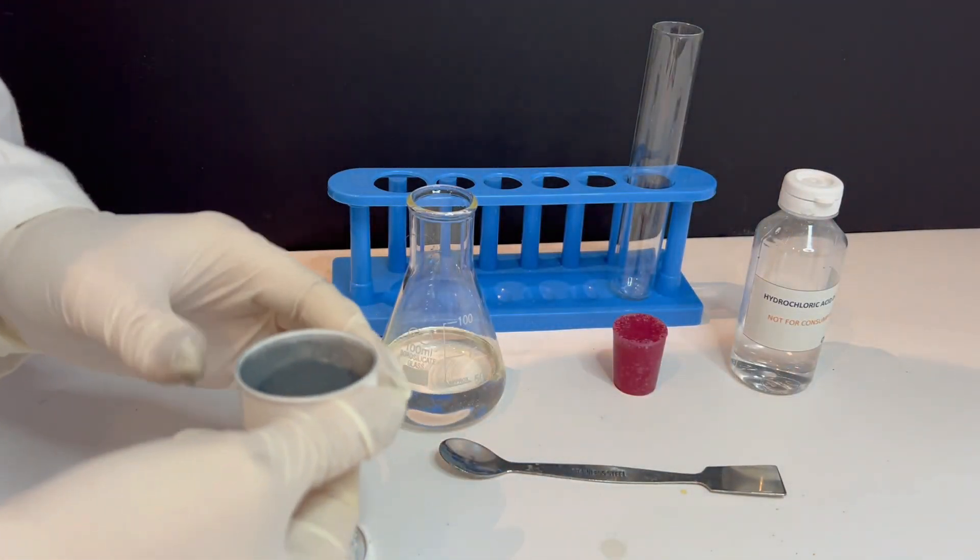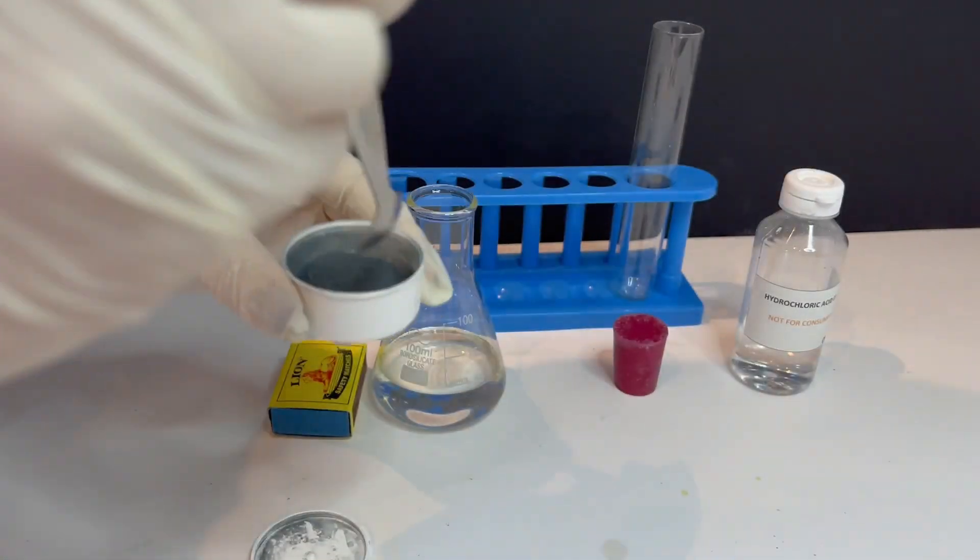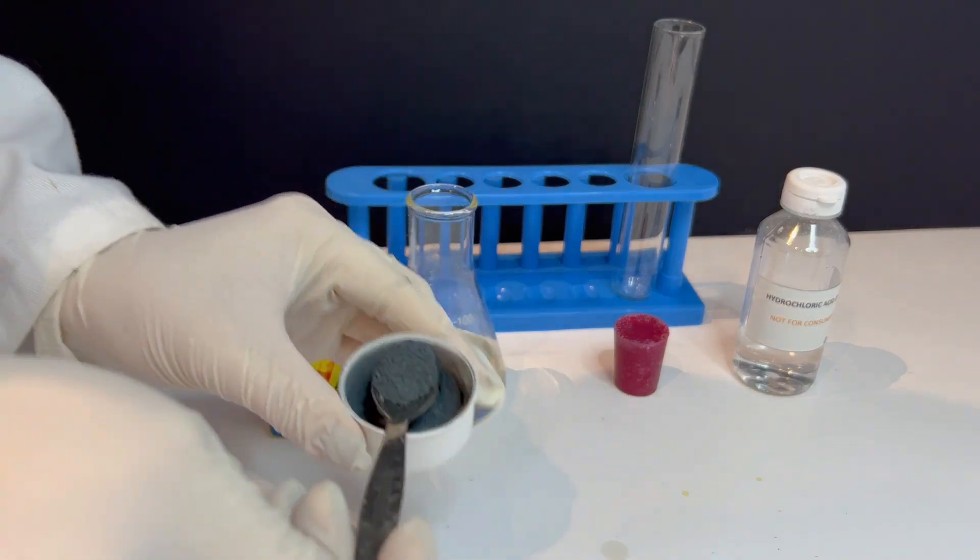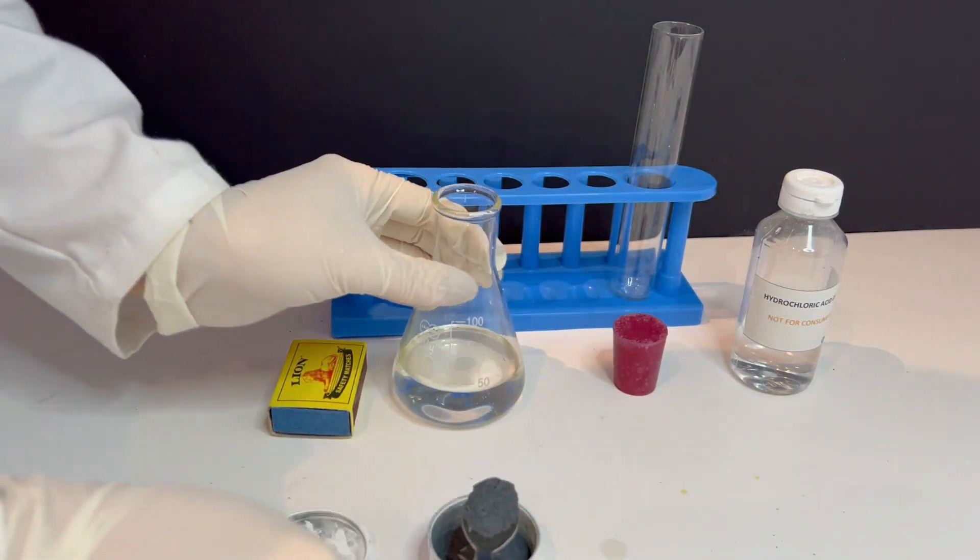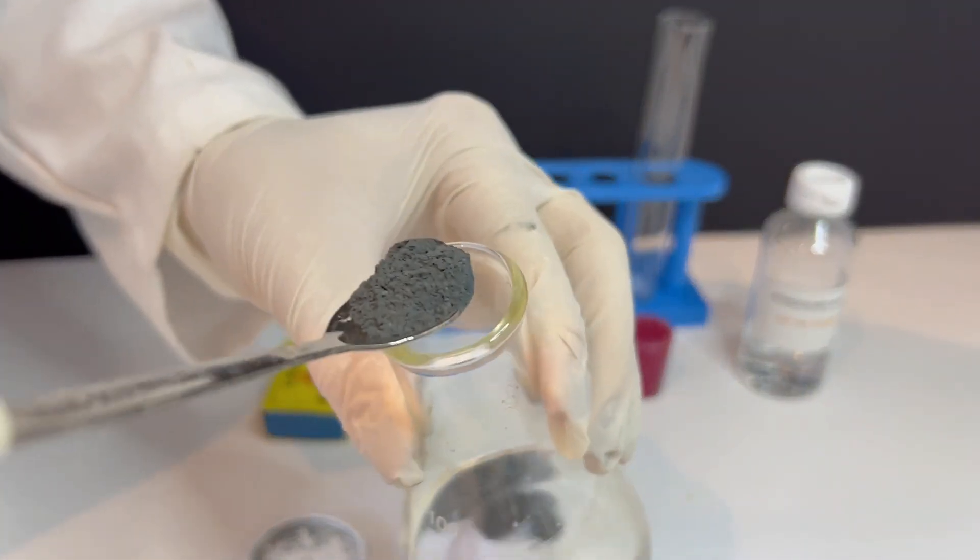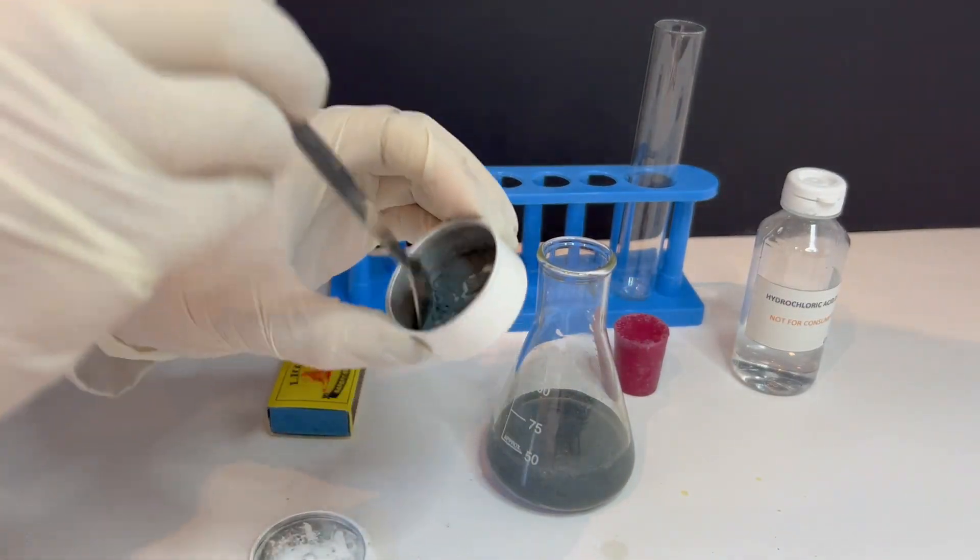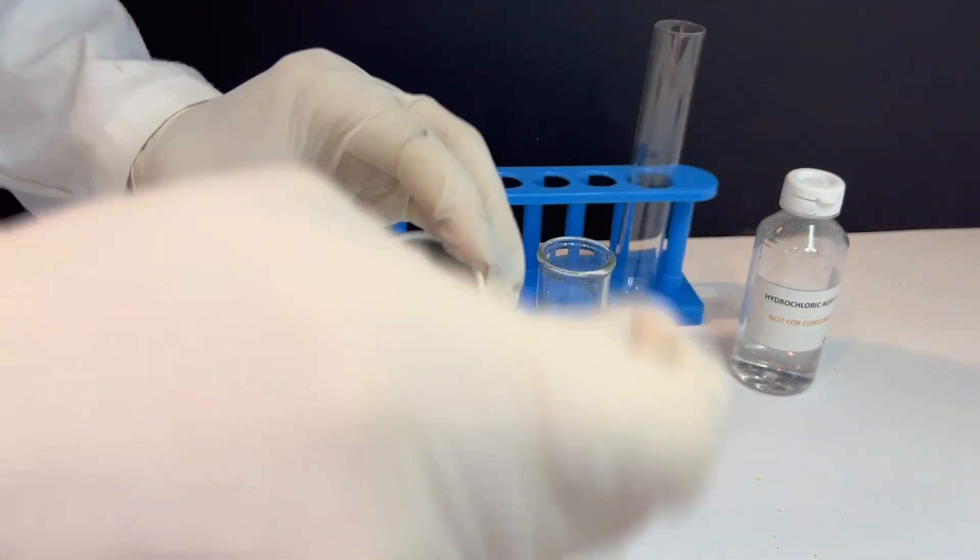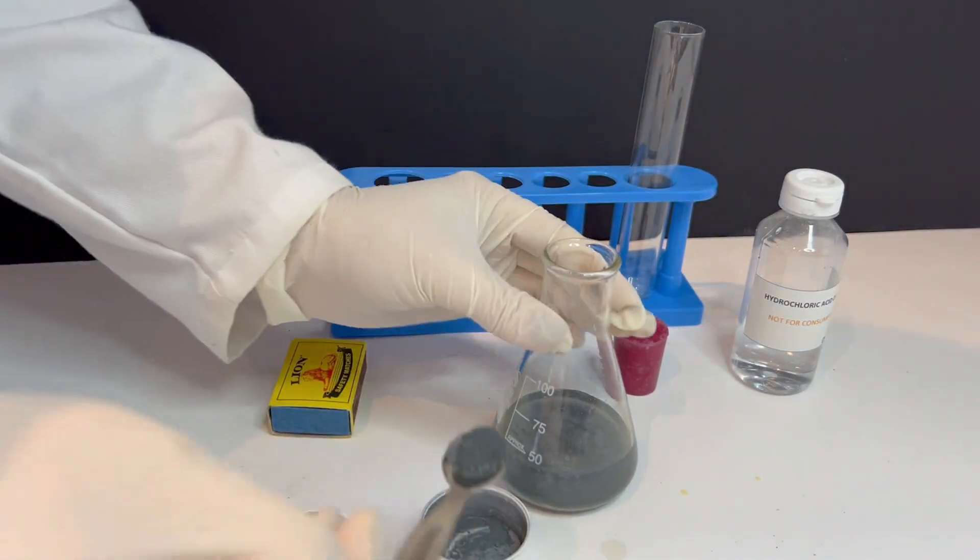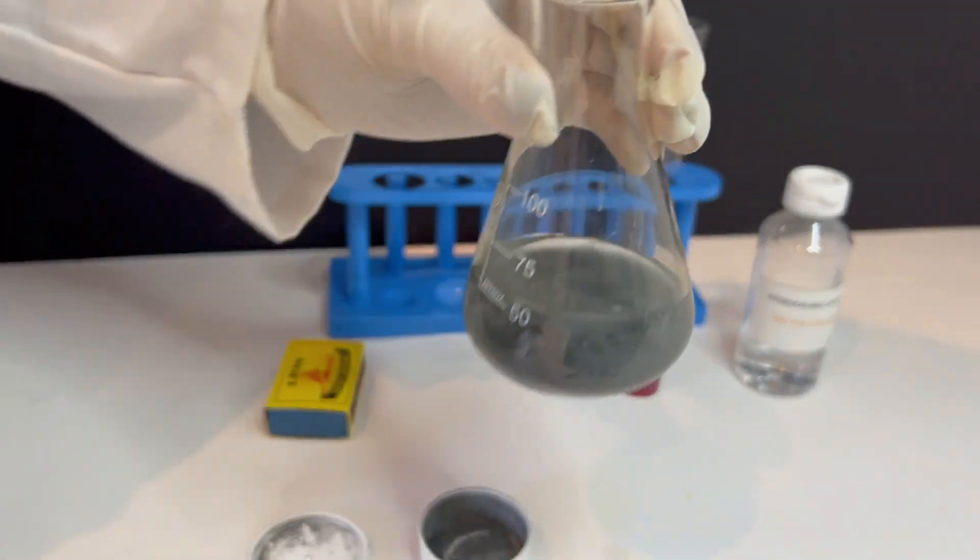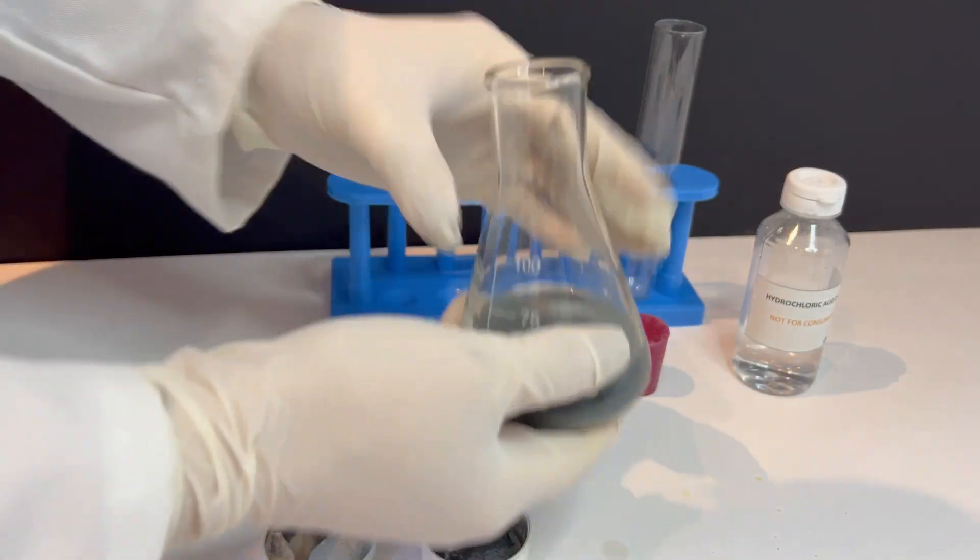Now, as soon as the acid touches the zinc, you'll see bubbles forming. That's a chemical reaction taking place. The bubbling you see is the production of a gas.